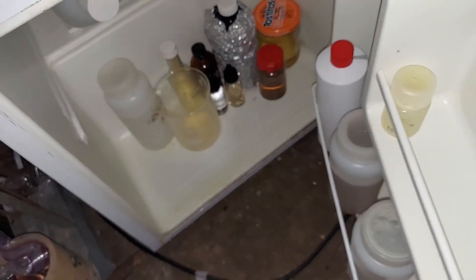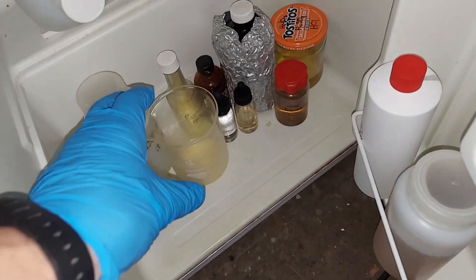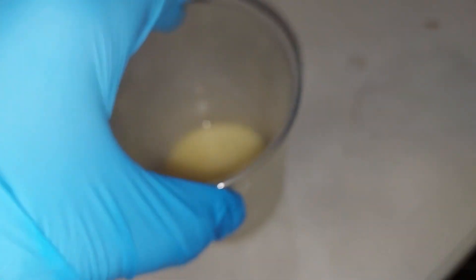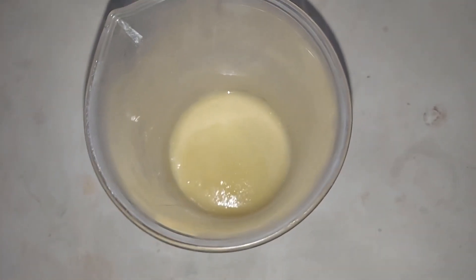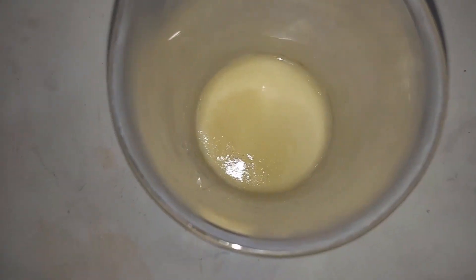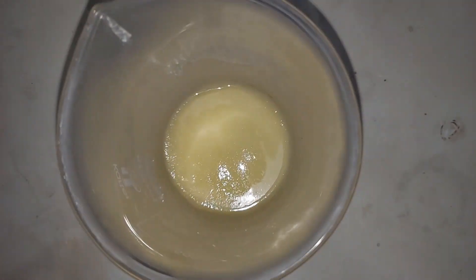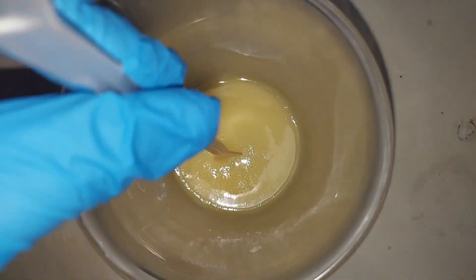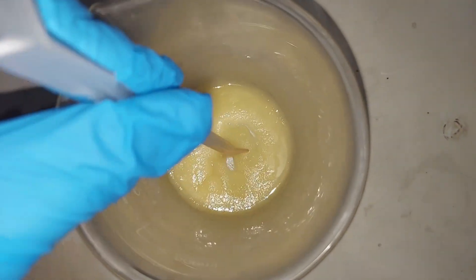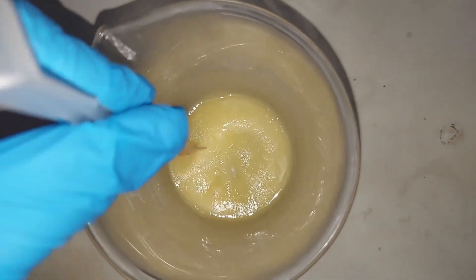It's the next day — let's see how our potassium carbonate is doing. Oh wow, I can already see it — check this out. There are a lot more crystals in there than there were yesterday. The brown liquid should wash away when I clean this with some cold acetone, but first it's got to be filtered.